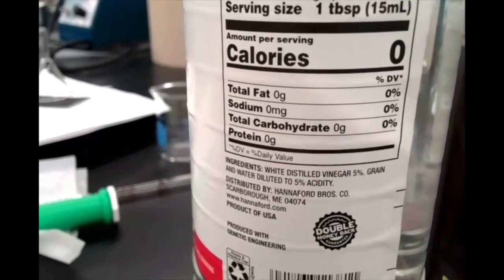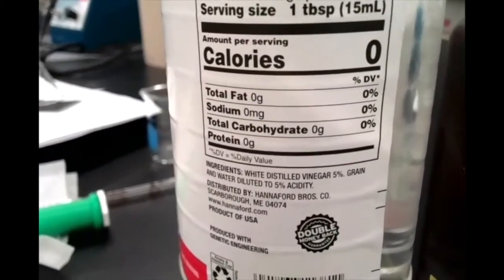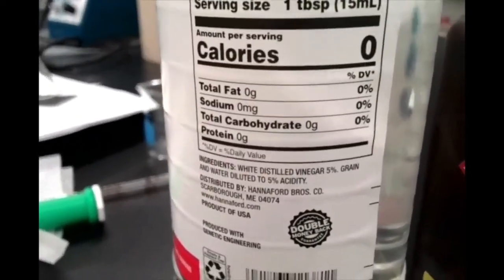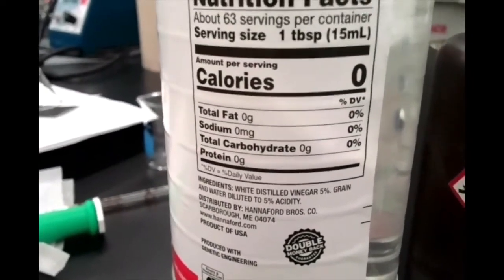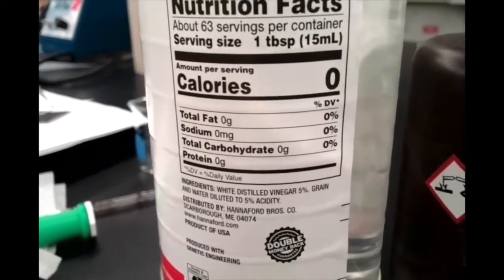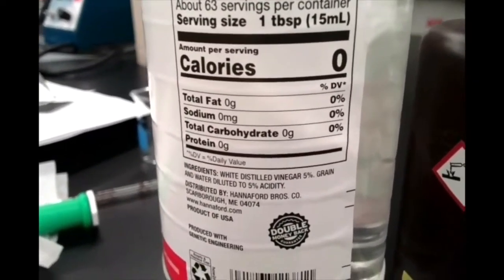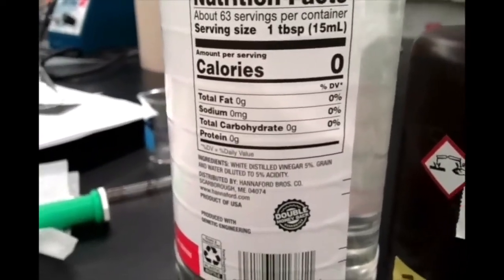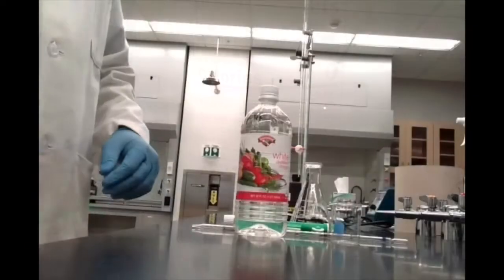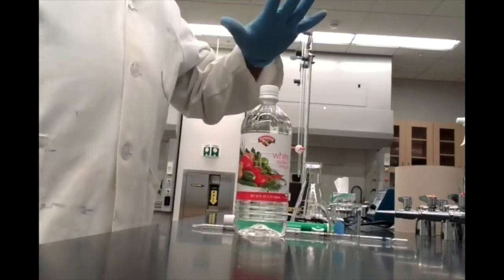So this is a great way to check your work at the end of the lab. When you're doing your calculations, hopefully you should wind up with your answer somewhere in that ballpark for %m/v. Of course, don't forget, we are doing two concentration calculations for our vinegar, both molarity and %m/v. This will help you confirm one of them, and hopefully if you get that one right, then that means that your other calculation for molarity is also correct.